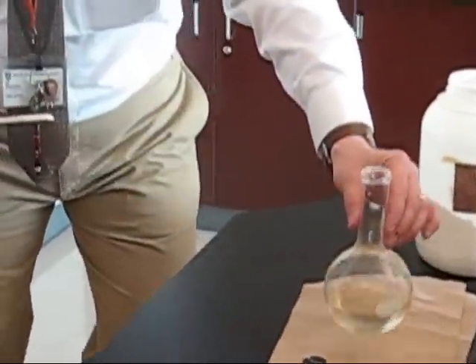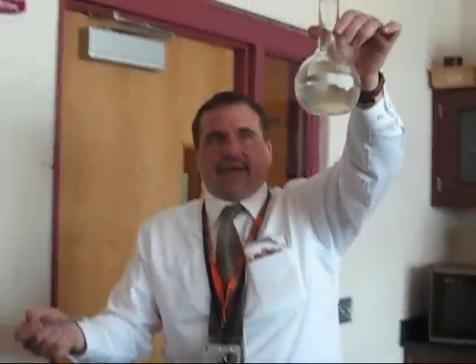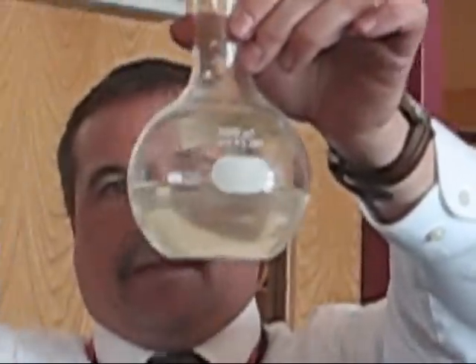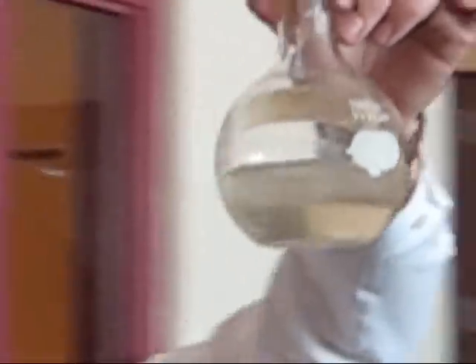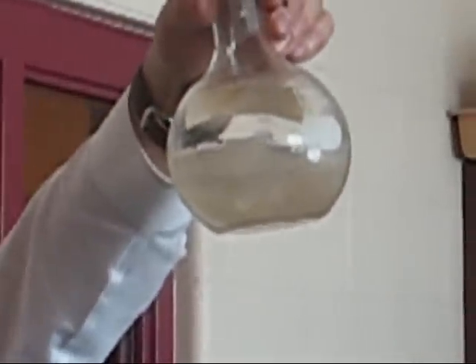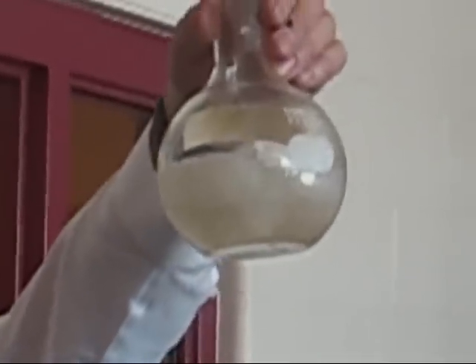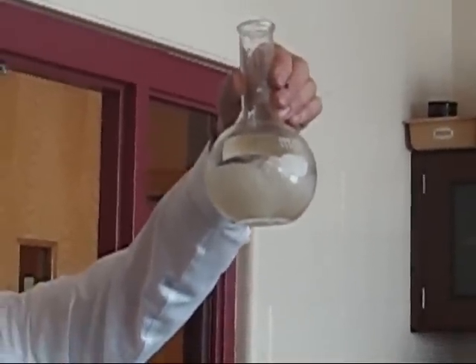You're going to see an interesting little phenomenon — it's kind of cool to watch the crystals. I'm just going to put a couple of crystals in. Okay, watch. They hit — now watch them grow. See the little needles growing? Can you see that? Whoa, it's like snowing or something in there. And they all form into one solid mass of crystals.